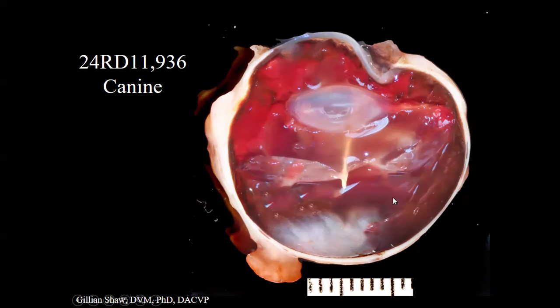And so as you can imagine, as this eye was embedded with this cut side down and sectioned from there, this relatively impressive linear foreign body would only be sampled in a tiny bit here. However, I think Megan grossed this one and she cut the cap off this globe, which we always do when we are processing eyes, and then submitted an extra section of the cap because some part of this thing was in the cap. So I will actually start with the whole globe.